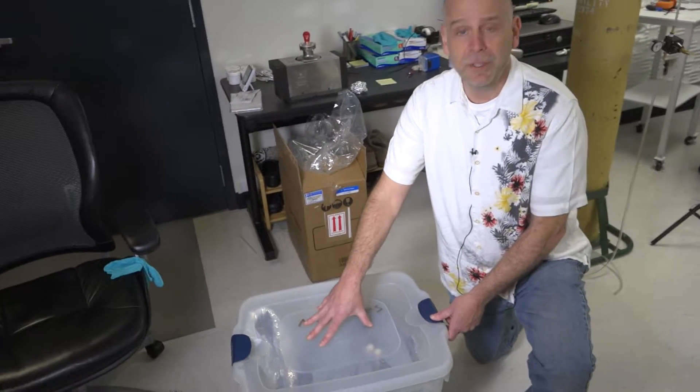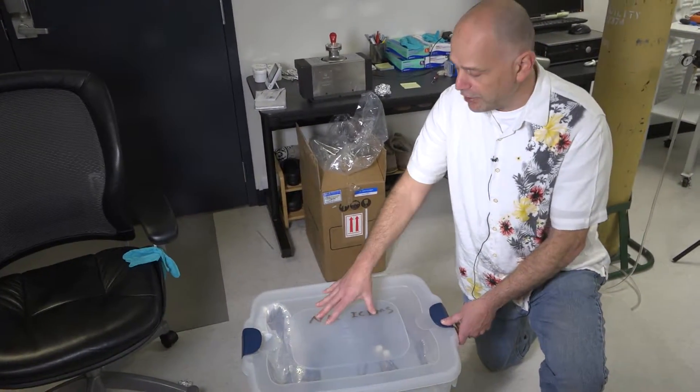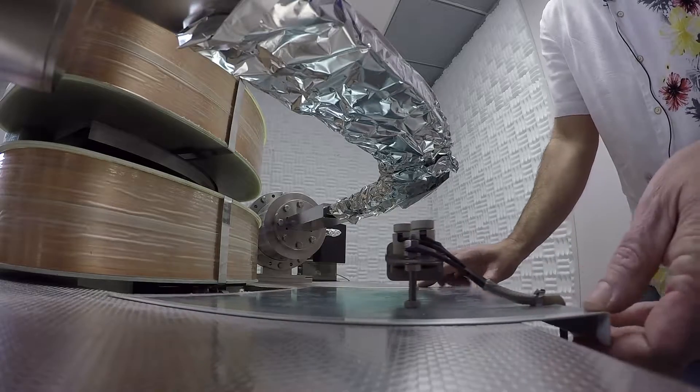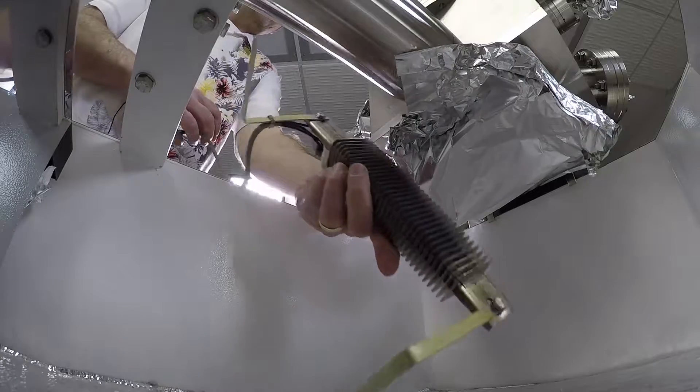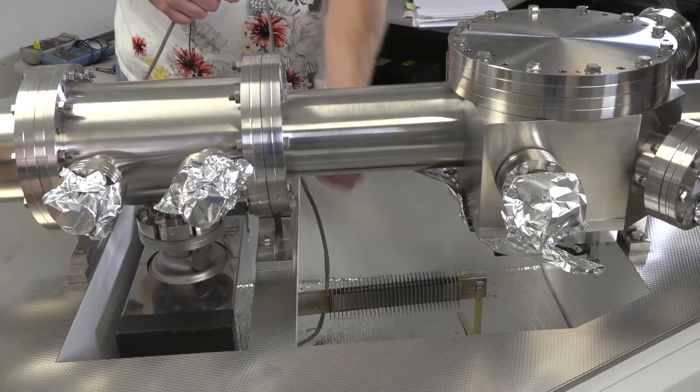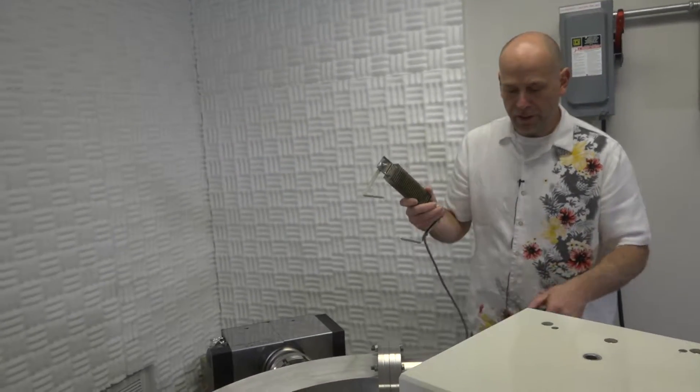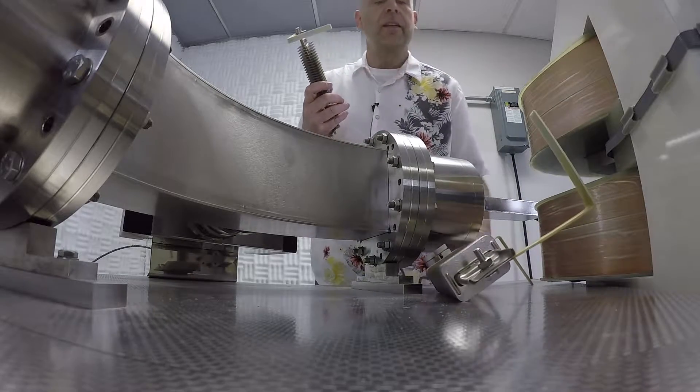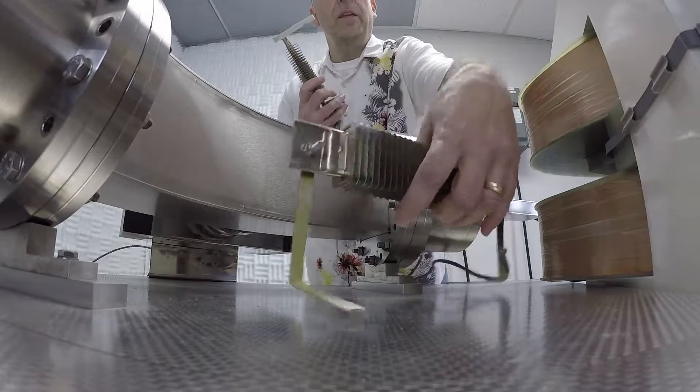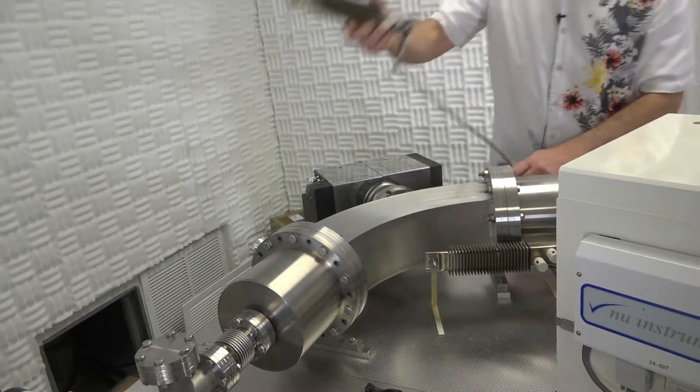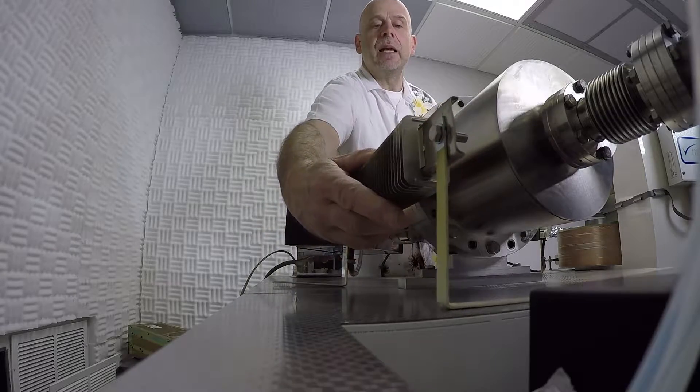So we have kept the original bake-out oven from installation. The heater that slides underneath the flight tube is the one attached to a large metal tray. The single heater goes underneath the flight tube by the collector block, and you want to orient it parallel with the flight tube. So the double heater goes on the ESA part of the flight tube and slide the one end underneath and orient it in that manner. And the other one can go on the back side over here.